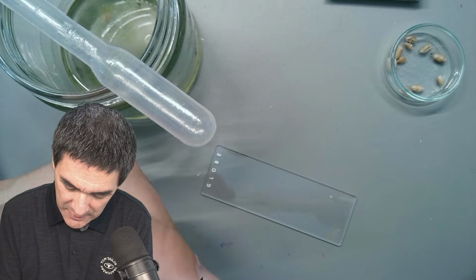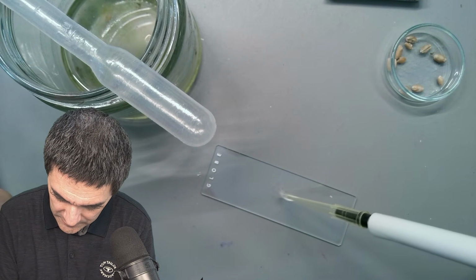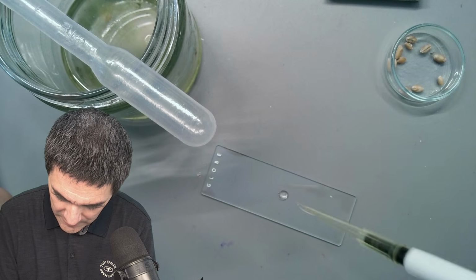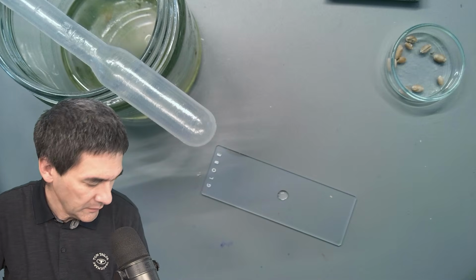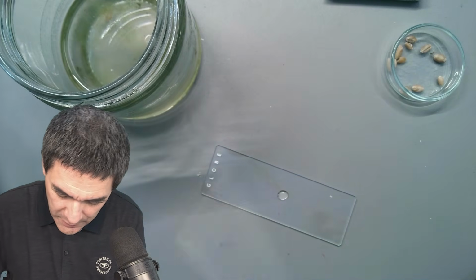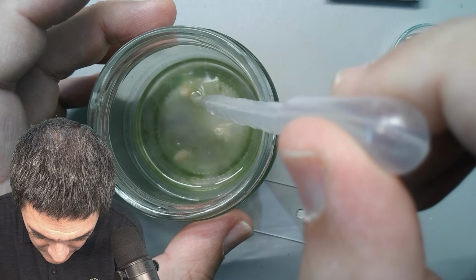So let's take again here, over here. Yeah, a little bit less now, and here. I don't know. Maybe there's already enough. Let's try to follow. Let's not go all the way in, but here a little bit on the side.